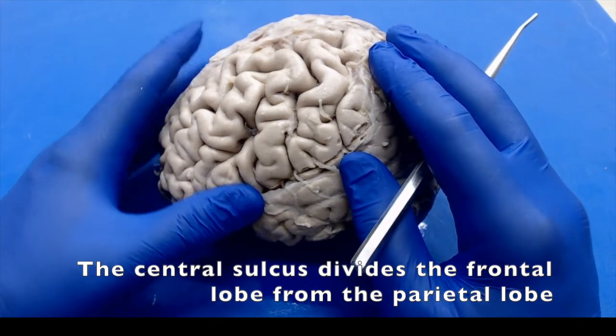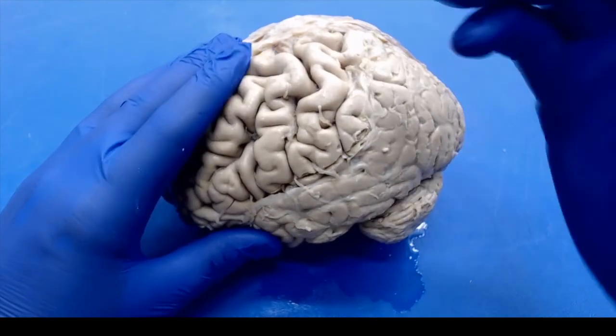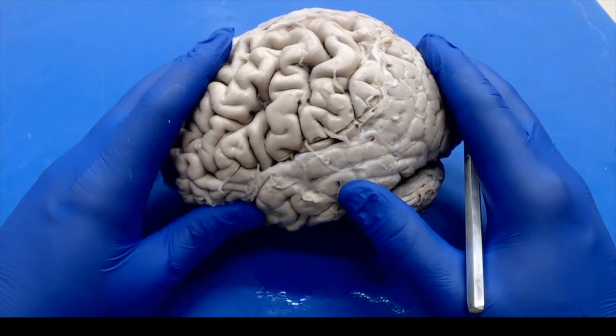Next to that, you've got your precentral and postcentral gyrus, and those have various functions about controlling your motor and your sensory receptions for the entire body. So those are important in neuroanatomy.